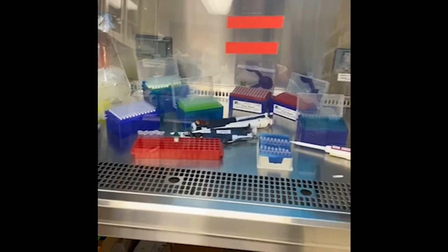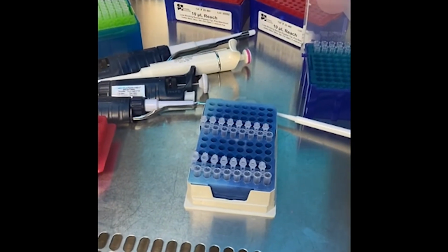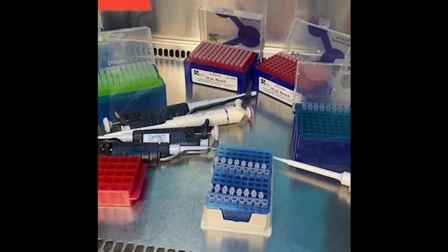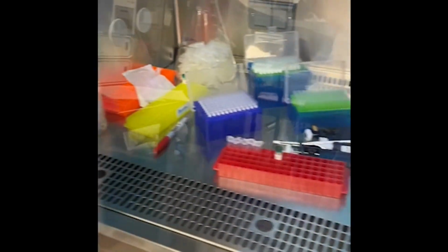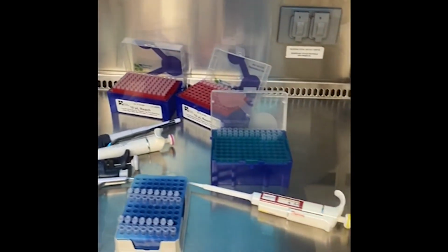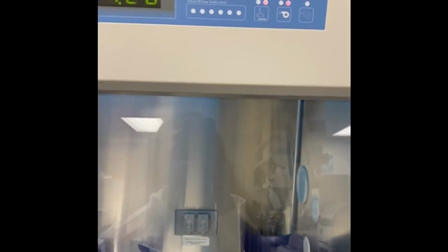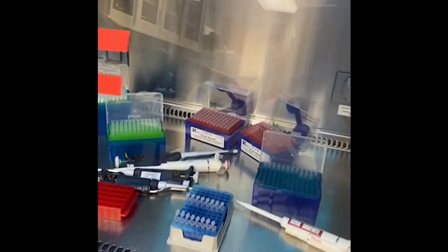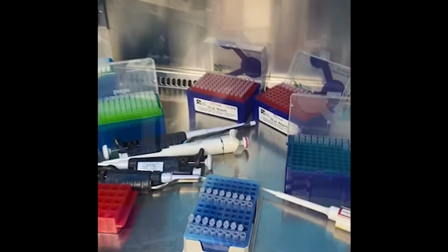So in this hood, all the materials and the tools and the pipettes and these PCR tubes, after I clean them with the ethanol, sterilize them with ethanol, as well as using RNase Away reagent. So I try to sterilize and remove any inhibitors on my equipment tools. Now it is being UV sterilized, and UV would degrade if there is any DNA or RNA. So hopefully I will not get any contamination in my reagents.